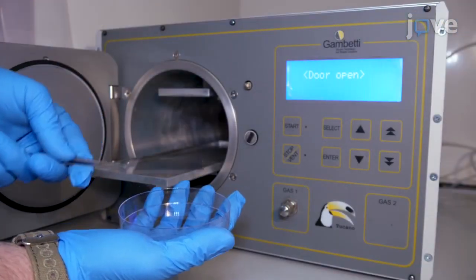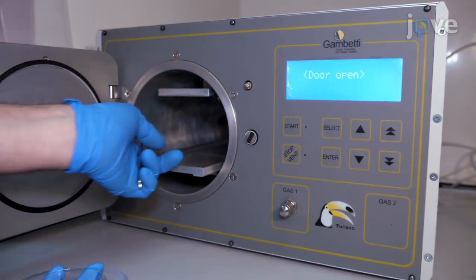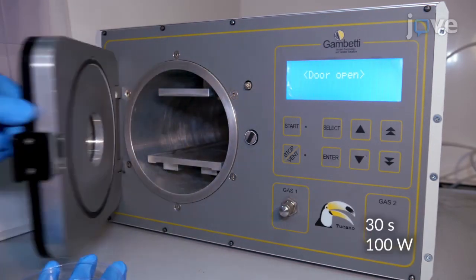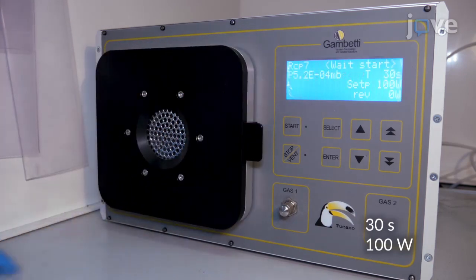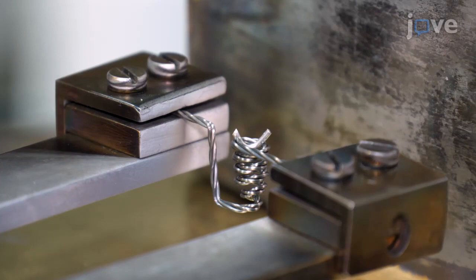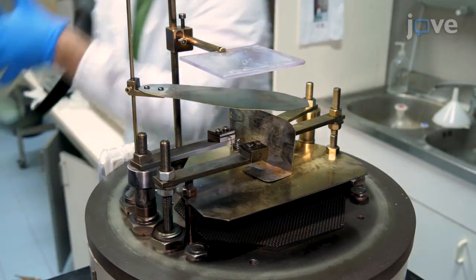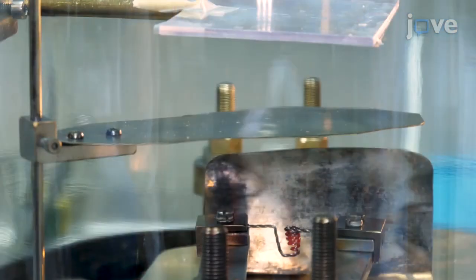For titanium deposition, pre-clean the substrates with plasma oxygen and place them on the substrate holder inside the vacuum chamber of the thermal evaporator. Next, place 60 milligrams of titanium in the crucible, close the shutter, and pump down the evaporation chamber until it reaches 10 to the minus 6 torr. Increase the power of the evaporator until the crucible glows red and wait for 30 seconds.